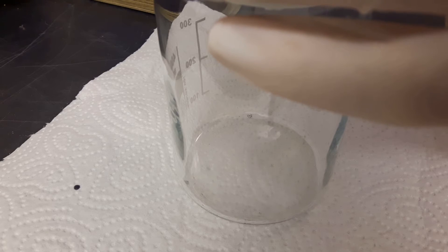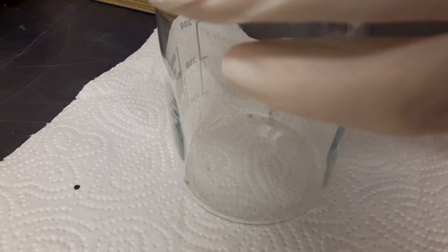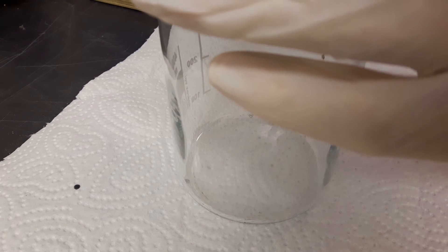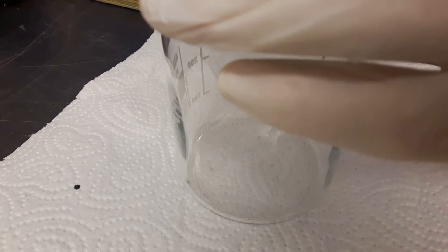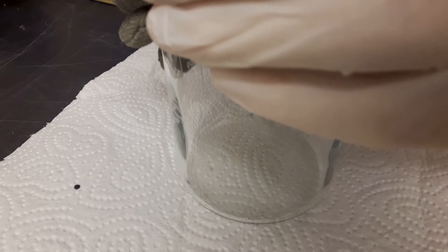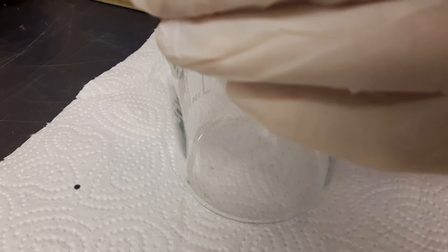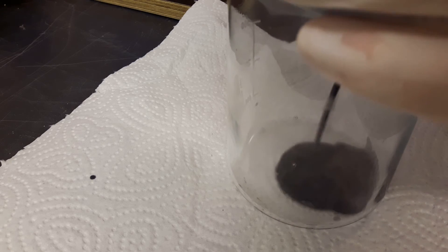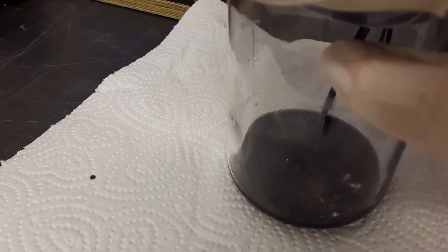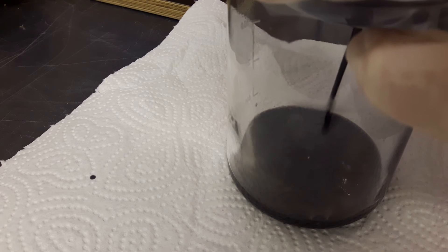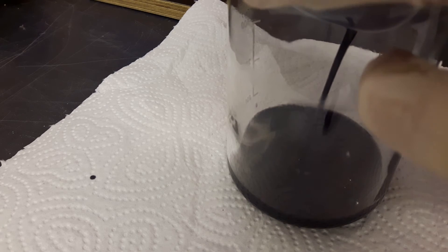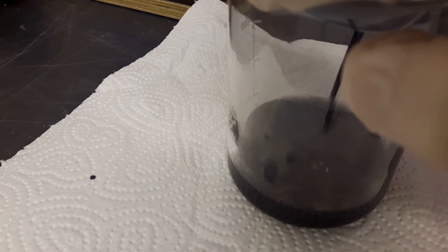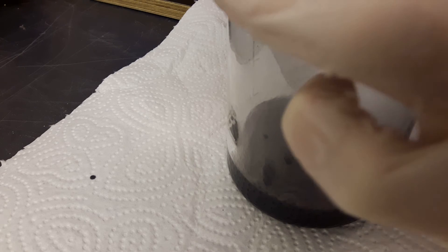And here you can see that although I poured in all the flask's content. Nothing makes it through to the beaker. So everything is stuck into the filter paper. And I had to use a screwdriver to puncture it. To allow everything to go through. So really this didn't work at all. So don't filter this solution. This really doesn't work. The only way to purify it is distilling it.